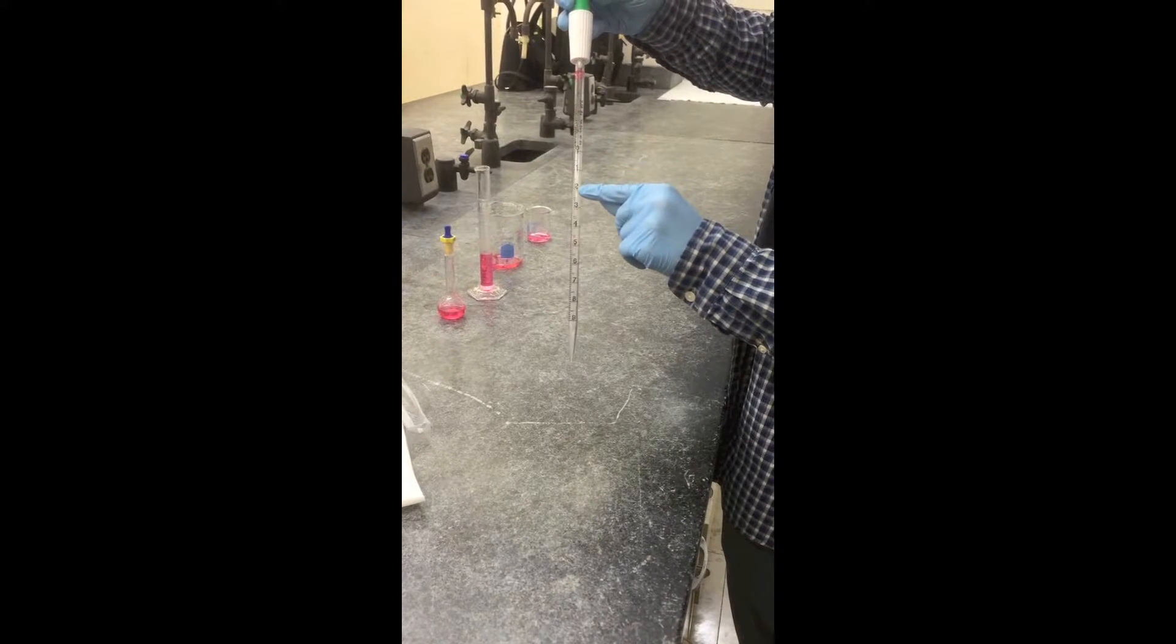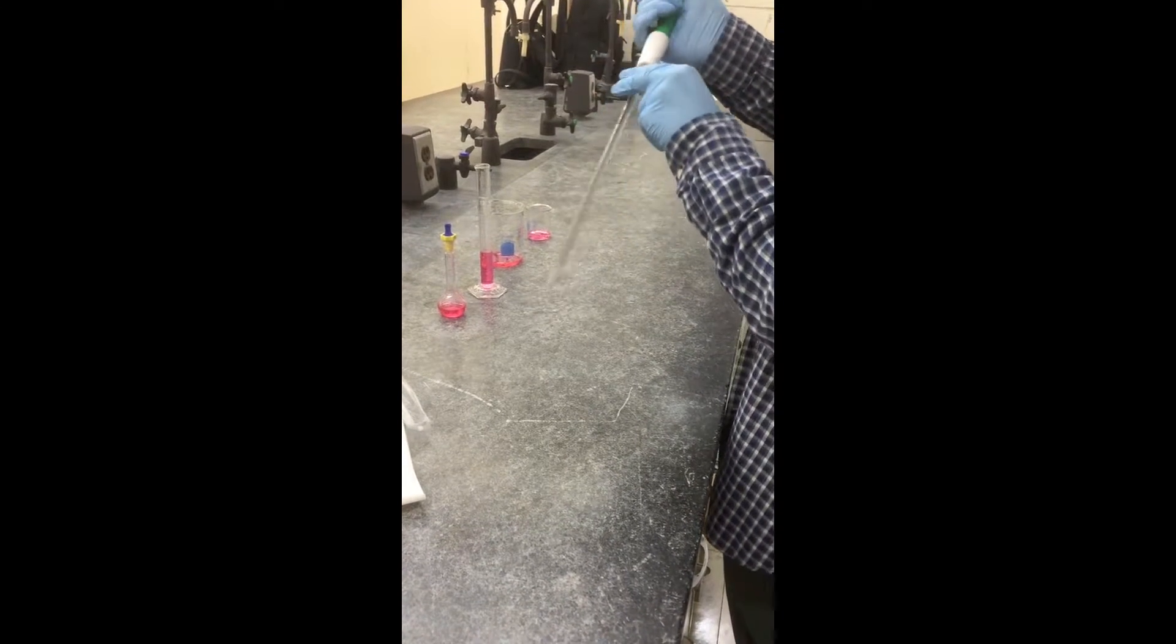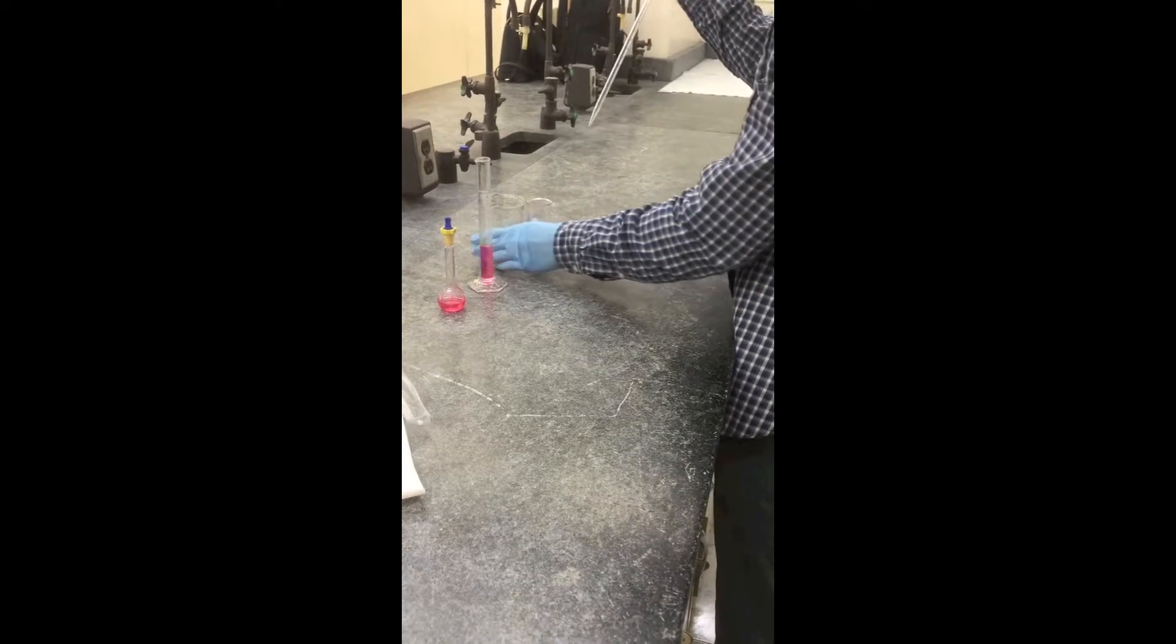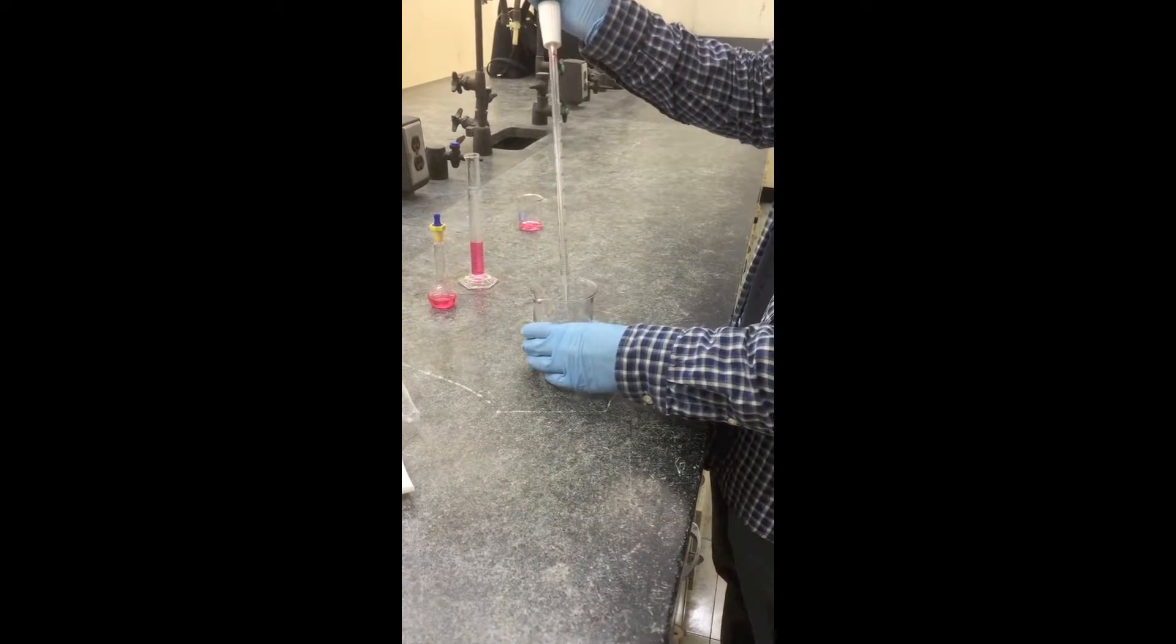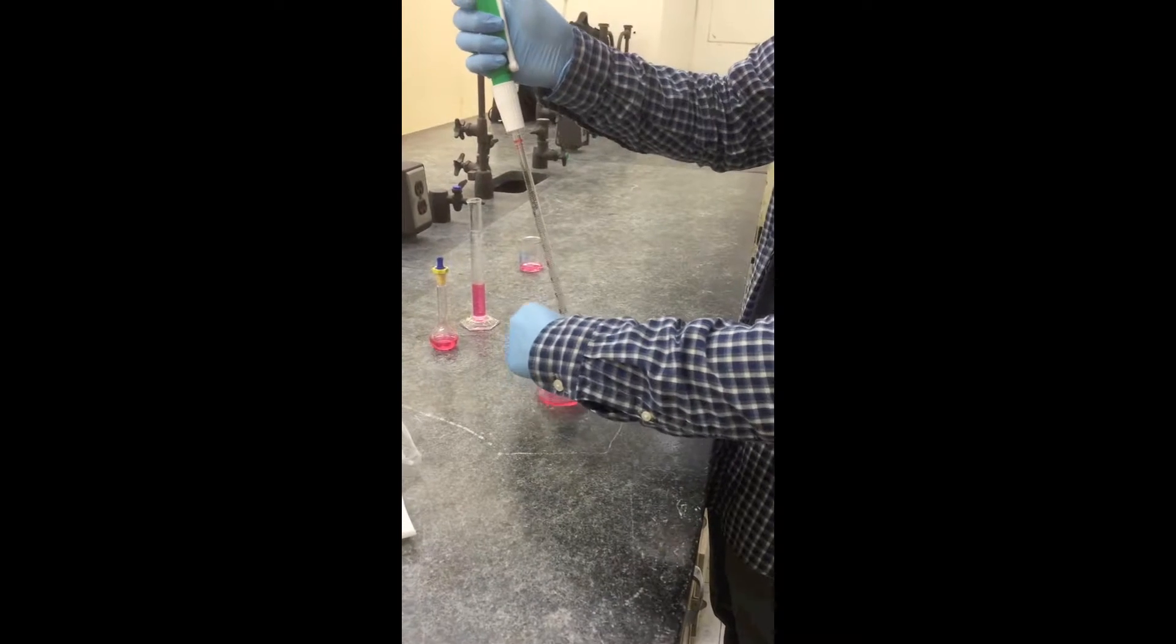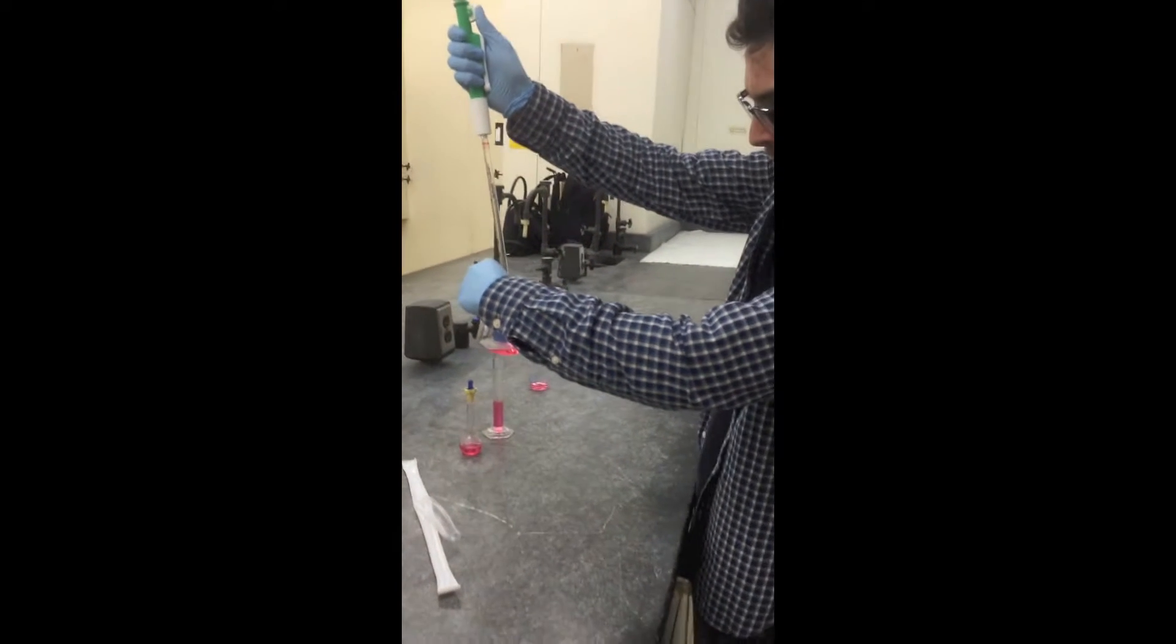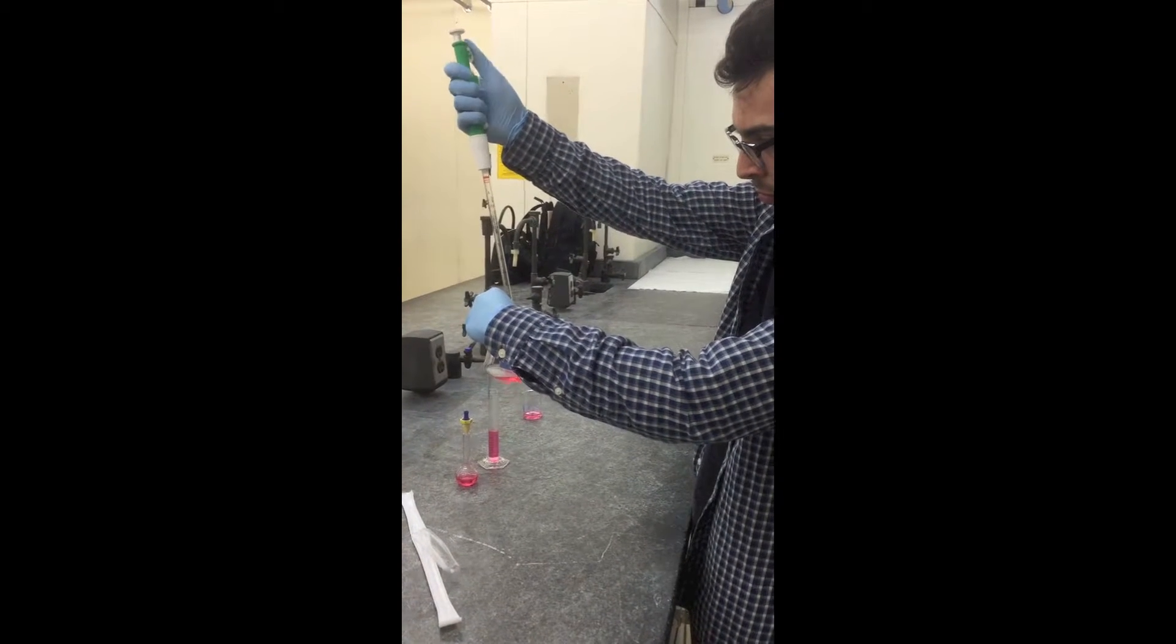Attach the pipette pump. Note that the markings on the two sides of the pipette are different. One counts up, one counts down. Be sure to know which one you're looking at.